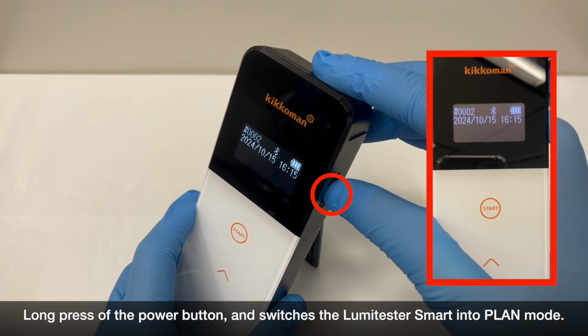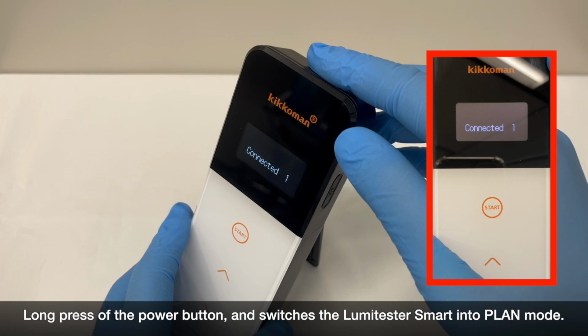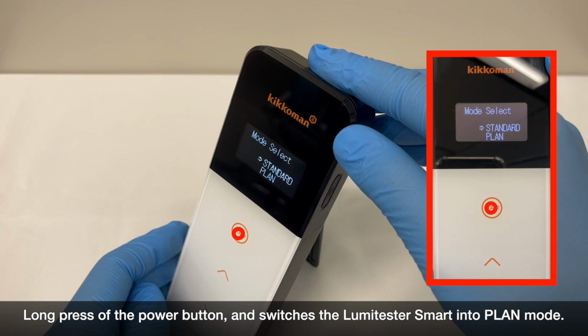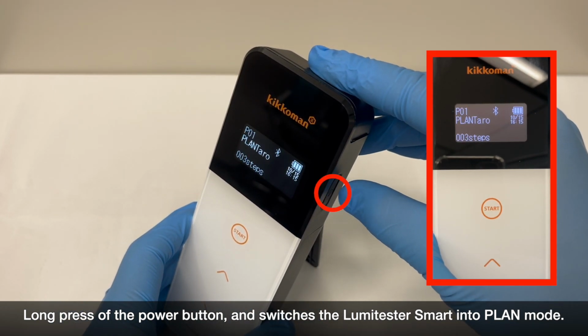First, with the Lumitester Smart turned on, please press and hold the power button on the side for at least 5 seconds to go to the settings screen. Use the arrow buttons to find the Mode Select menu and select Plan. If you will always use plan mode in the future, this operation is not required from next time.